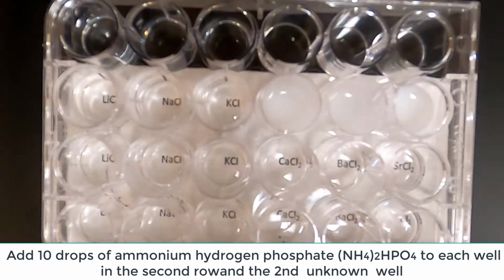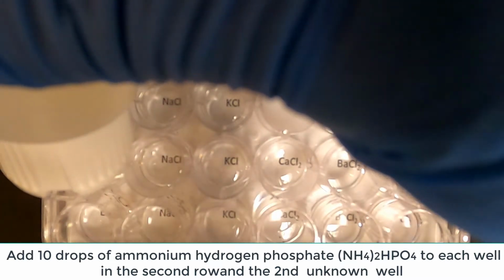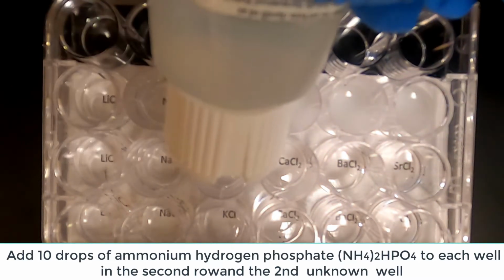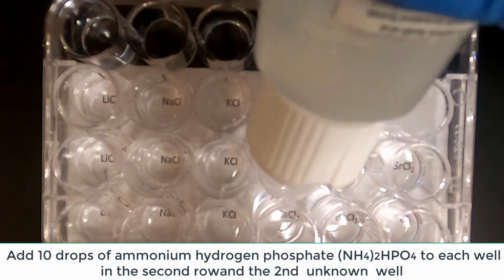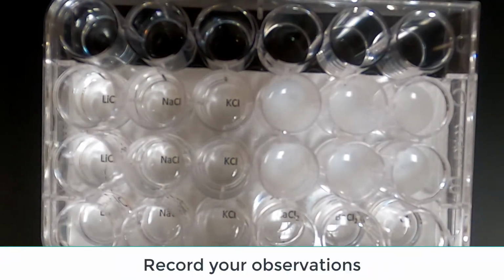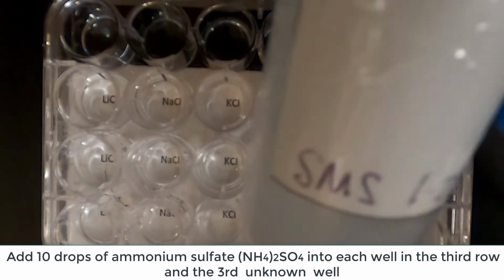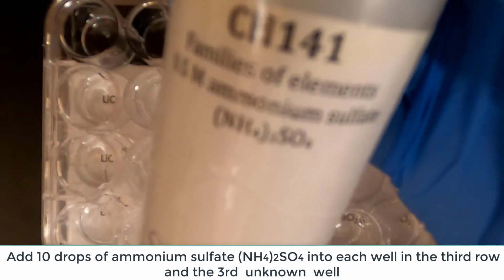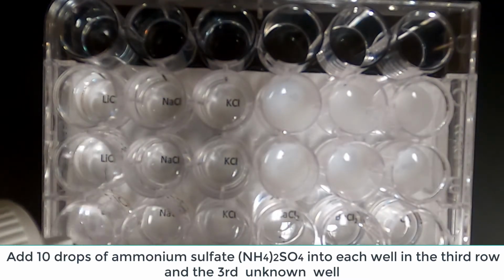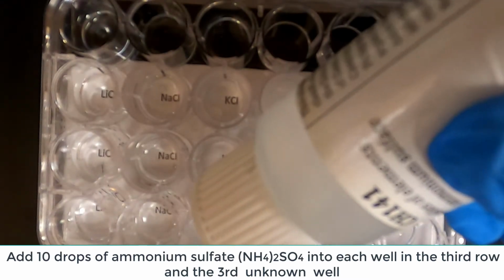In the second row and the second unknown well, add 10 drops of ammonium phosphate. Observe the reactions. Record your observations on the data sheet. In the third row and the third unknown well, add 10 drops of ammonium sulfate. Observe the reactions. Record your observations on the data sheet.